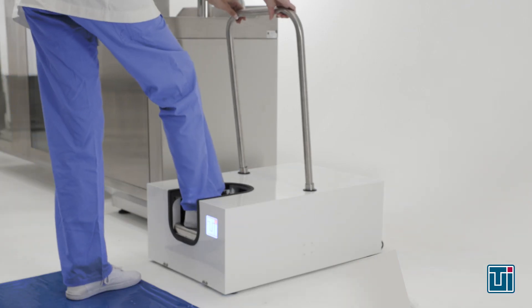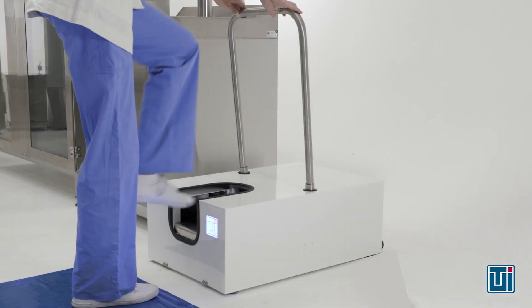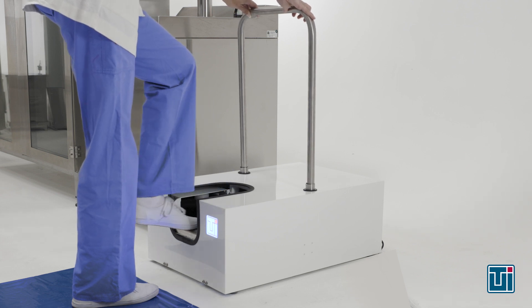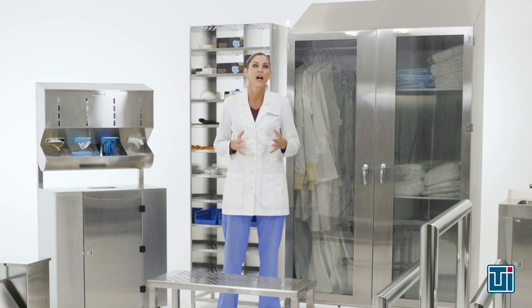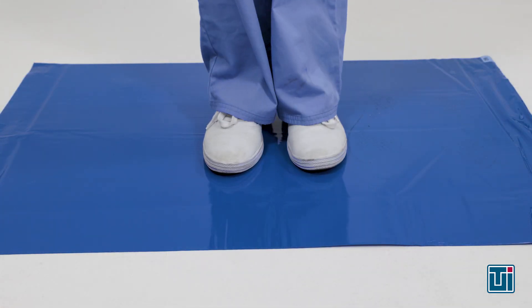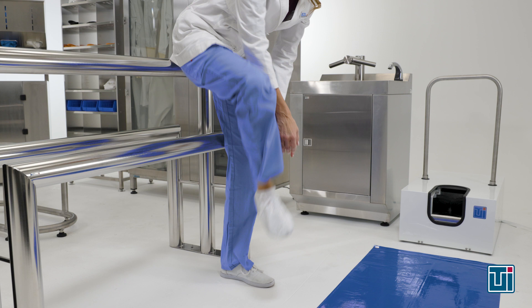The first critical step of the gowning procedure is to clean your street shoes before entering the gowning room. Terra's automated shoe cleaner includes a HEPA filtered internal vacuum system with multiple rotating brushes that remove particles from deep inside the shoe seams. You should install this device at the entrance of your gowning room alongside sticky mats that remove fine particles from the bottom of your shoes. After you've thoroughly cleaned your shoes, put on shoe covers to further minimize floor contamination.